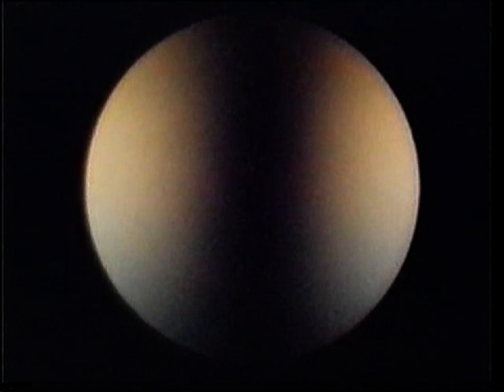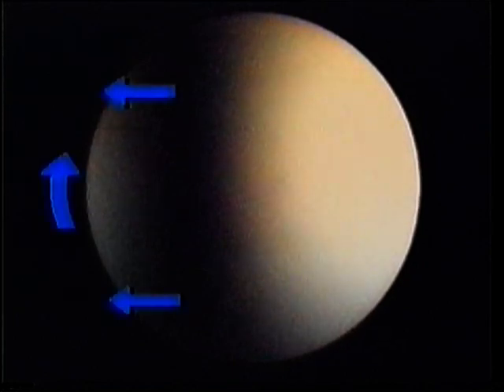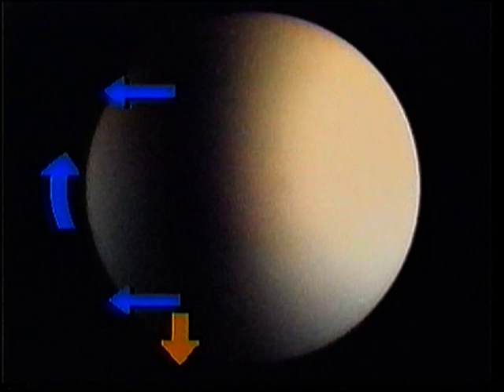Slight clockwise rotation of the stage results in this new position for the isogyre. The two ends of the isogyre have moved round the edge of the field of view in opposite directions. The end that rotates the same way as the stage is rotated is nearest the optic axis. Here, the southern end rotates clockwise, so the optic axis is in the direction of the yellow arrow, and the main quadrant visible is the northeast quadrant.